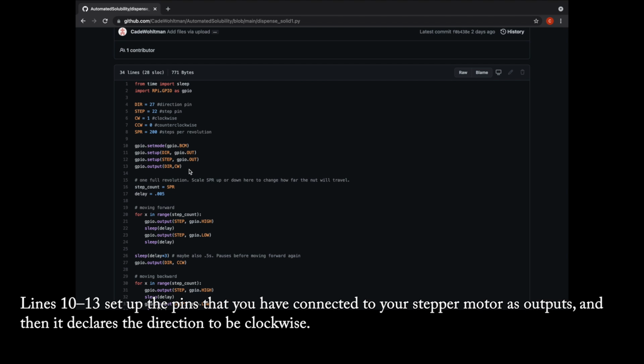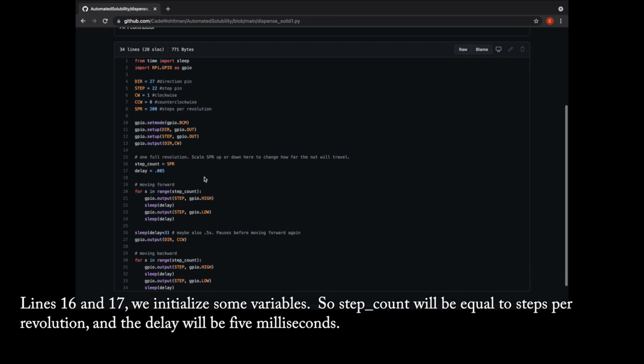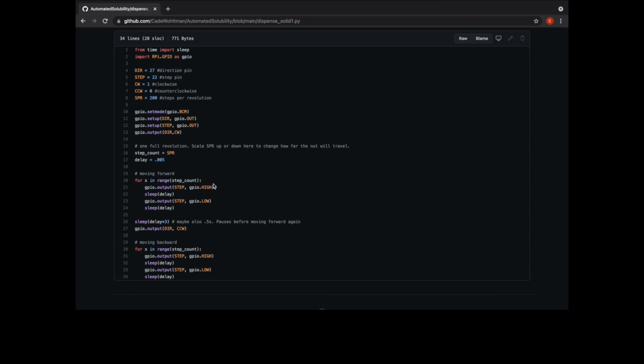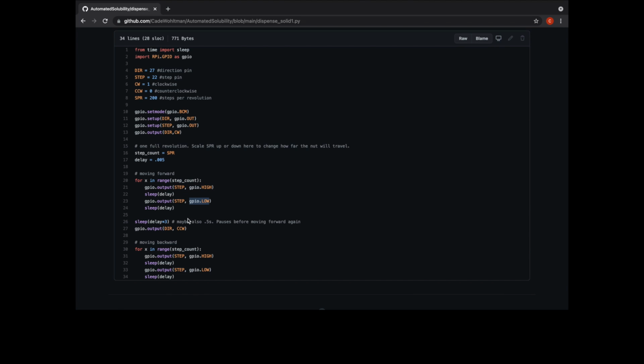Lines 10 through 13 set up the pins that you have connected to your stepper motor as outputs, and then it declares the direction to be clockwise. Lines 16 and 17, we initialize some variables, so step count will be equal to steps per revolution, and the delay will be 5 milliseconds. Since we've already set the direction on line 13, we run the for loop on line 20, which turns on our pin and then turns off our pin, sending a data pulse. This moves our motor forward.